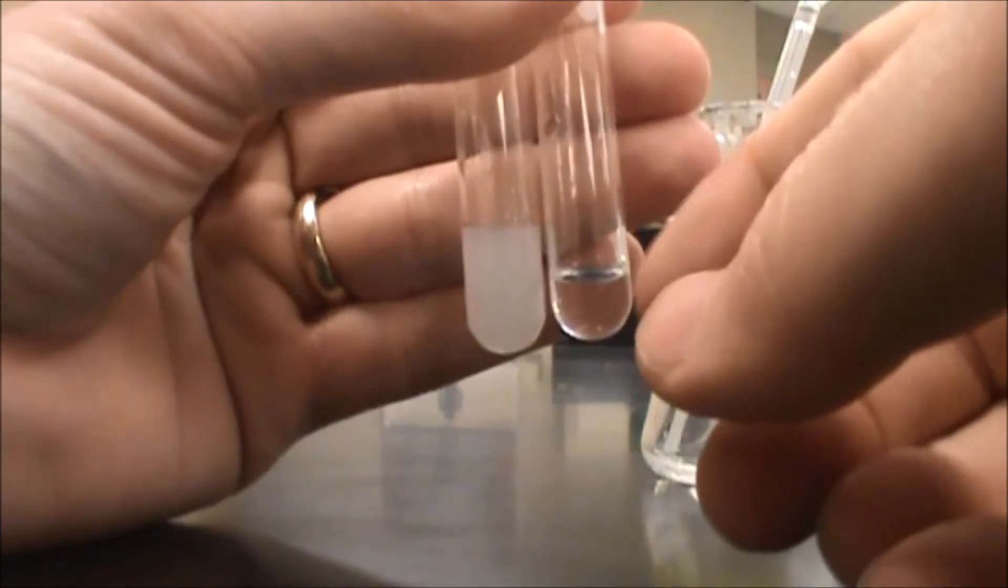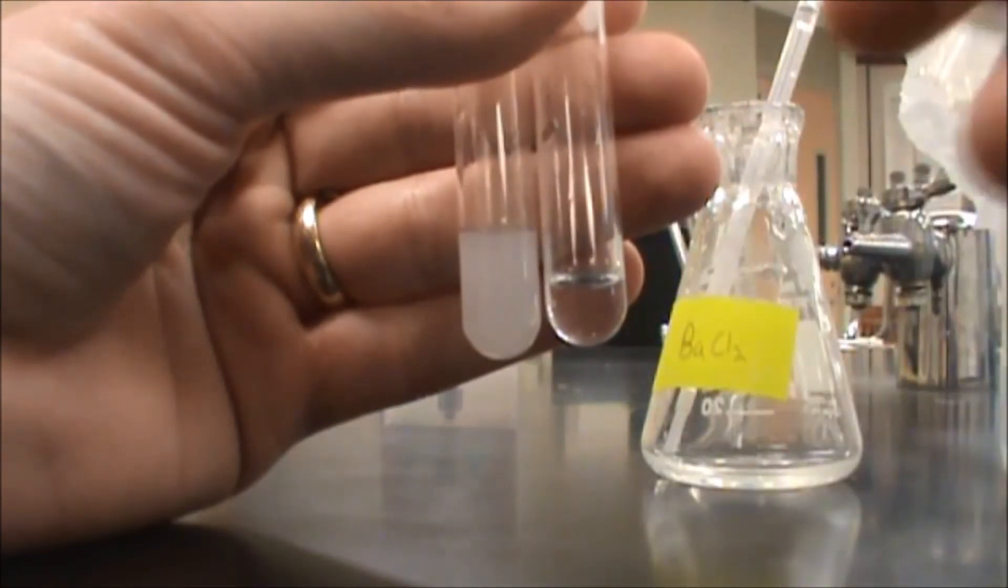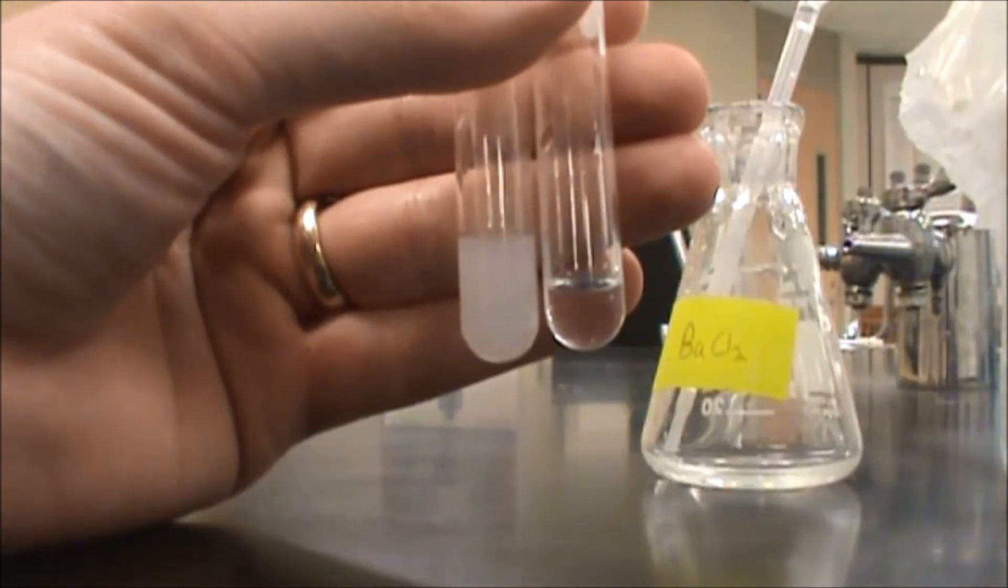the sulfate, barium sulfate has remained. And in this one, the barium carbonate that I formed dissolved in the acid. So that would be a negative result for a sulfate test.